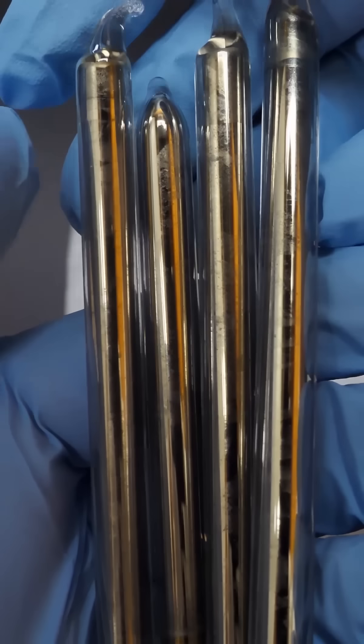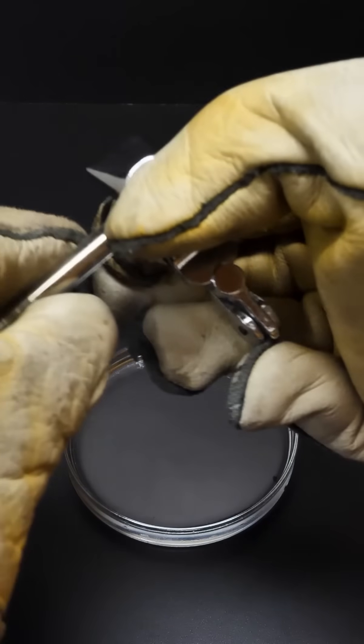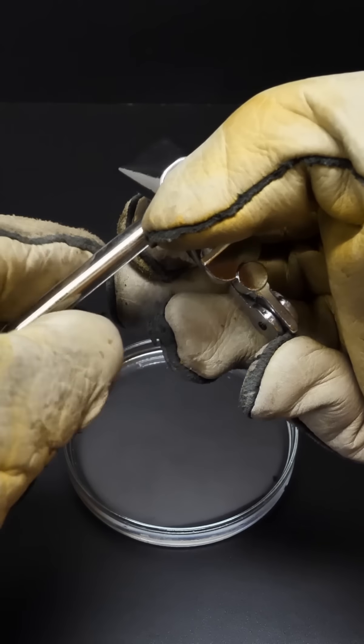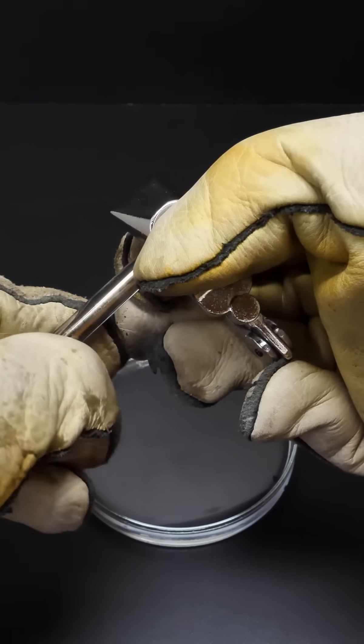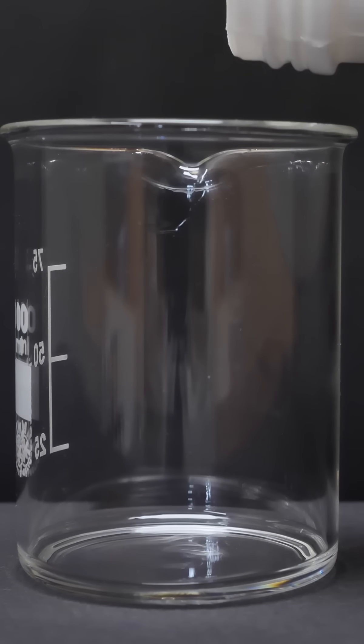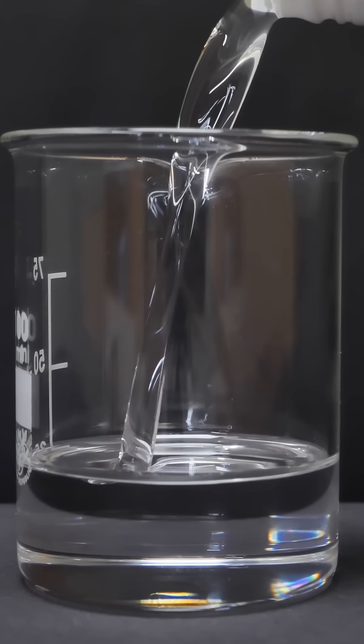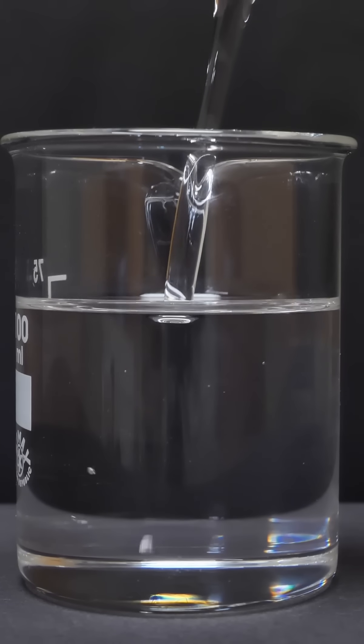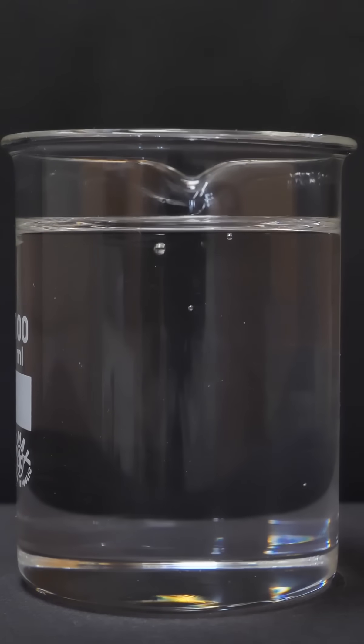Cesium is a golden metal. It reacts with oxygen in the air and just like all alkali metals, with water. It's so reactive that it can no longer even be stored in mineral oil, which was still possible with lithium, sodium and potassium, but must now be kept in a vial filled with argon gas.